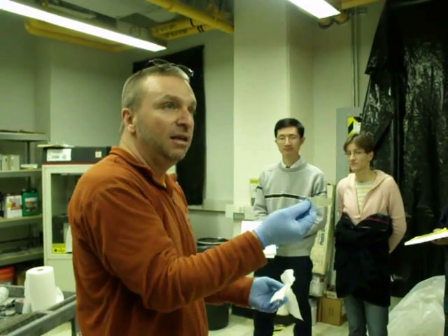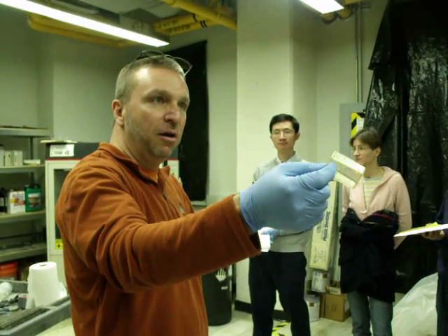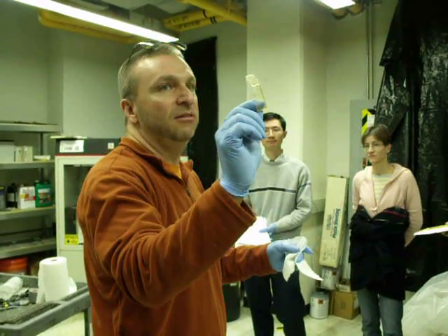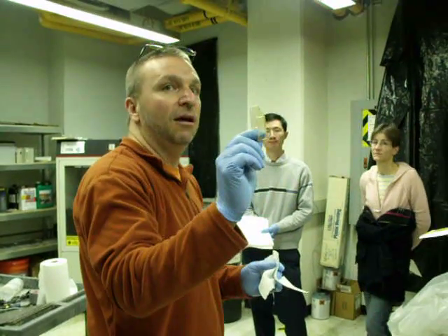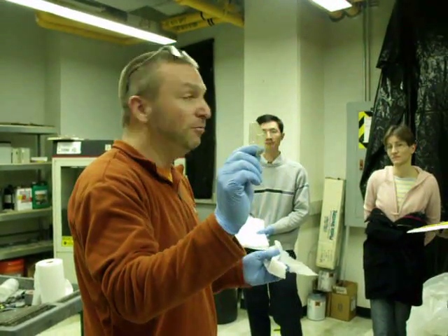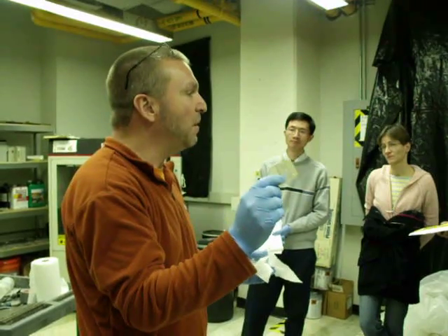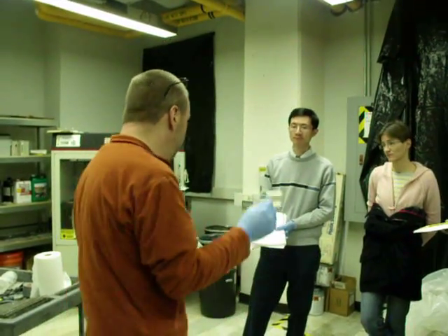And you should be putting these on before you remove anything. You should be covering those two mirrors where the laser actually focuses each time. You should be covering those up because if you get resin on top of that, then we're going to have to get someone from service to come in and clean it. And I'm not sure what person's advisor would want to pay probably a couple $1,000 to have that done. I mean, service is real expensive, so we probably want to keep that from happening. But there's resin. I mean, this is covered with resin, so this really needs to be cleaned.